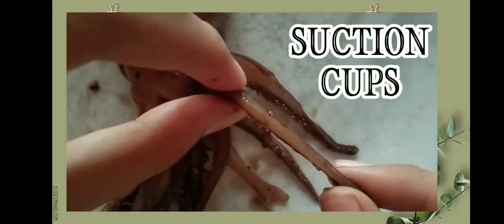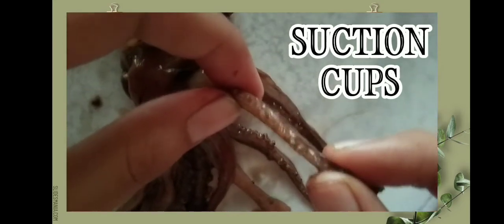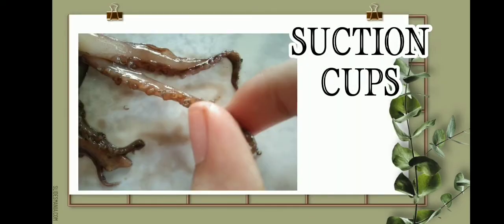Suction cups. These are also called suckers. Suction cups actually have a small tooth ring around each cup. They function like suckers, which help the arms to hold prey tightly to avoid escaping.